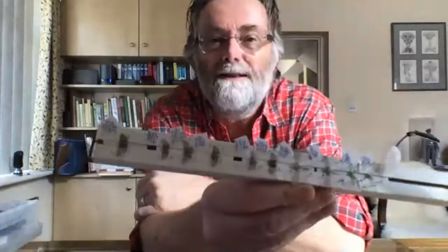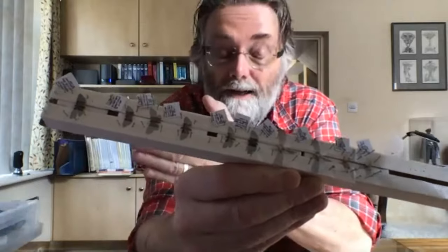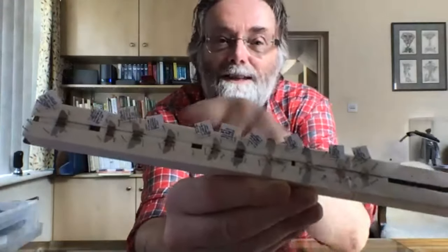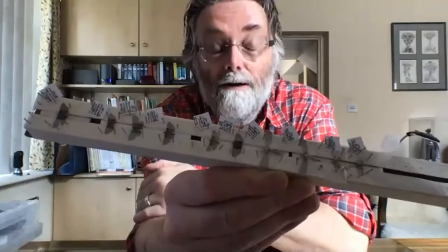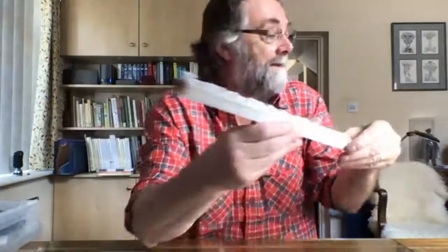The next problem for a lot of people is if you're not going to pin. What we have are things like this little setting board — this is a little group of micromoths I've been collecting through the year. I've killed them and pinned them, and then each of these will later be dissected. I'm not really expecting anybody to have to do that, although we could do that as a session. But what I would really want to say is: kill the specimen. Freezing is the easiest method, but I actually use a triple method.